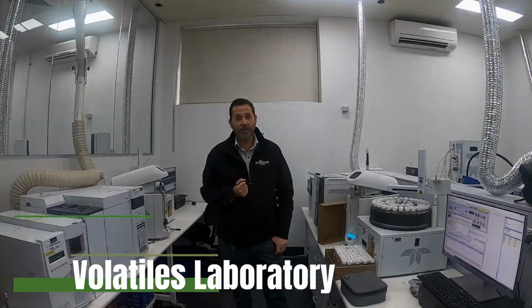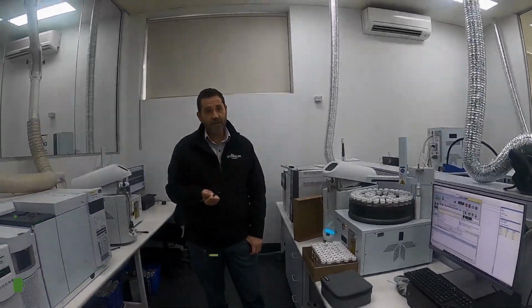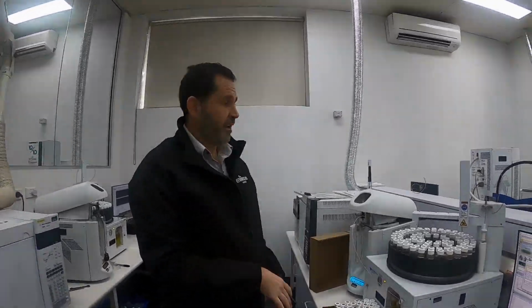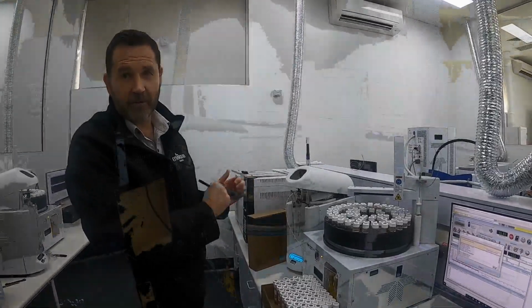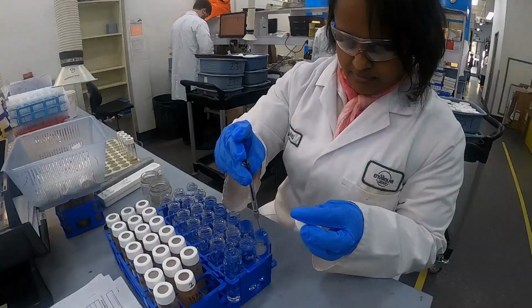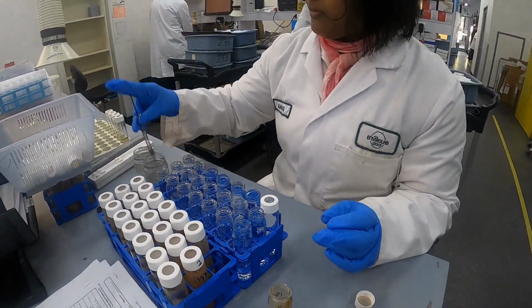This is our volatiles laboratory, and in here we're doing all of the volatile analysis, things like VOCs, VHCs and BTEX. Now all this analysis is done on a purge and trap. Remember to always let us know if your sample is pure product, as pure product cannot be run on these trace level instruments.